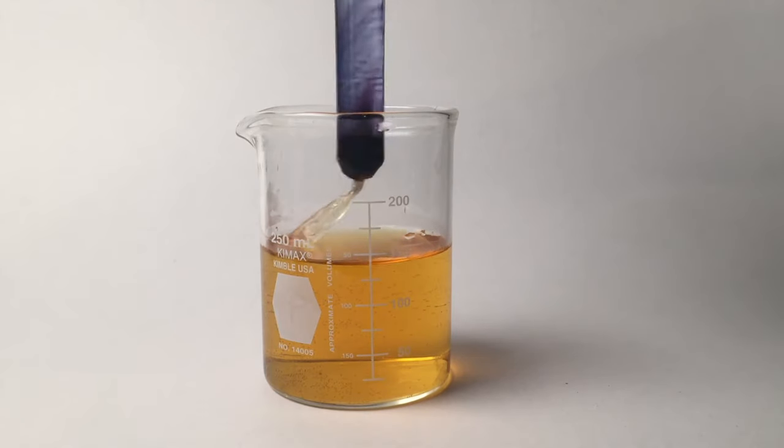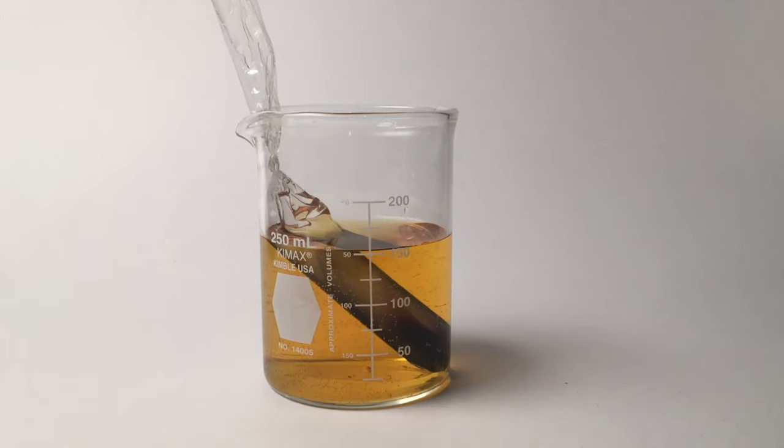So if this bag turned a color like that, that means iodine must have made it into this bag to react with the starch to give it a positive test. And that is why it turned a purple, black color. The outside of the bag or the cup stayed yellow so it is a negative test for starch. Starch did not get out of the bag.